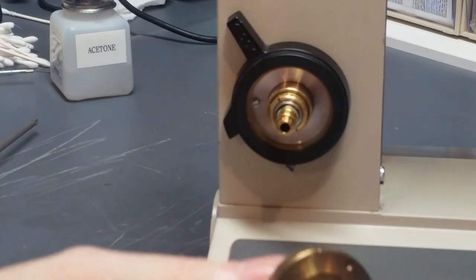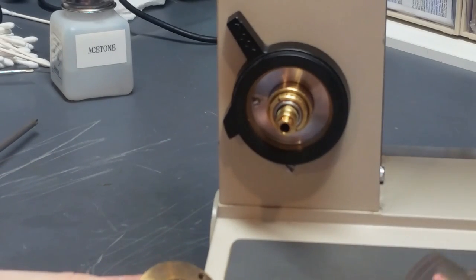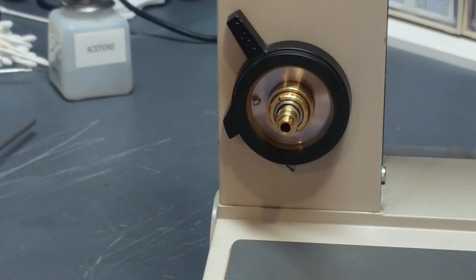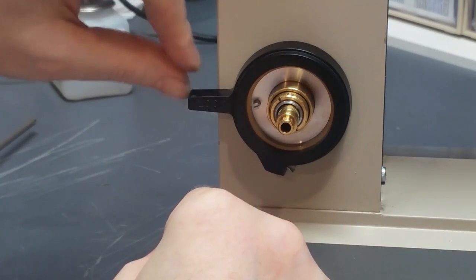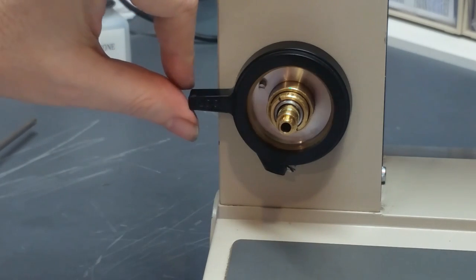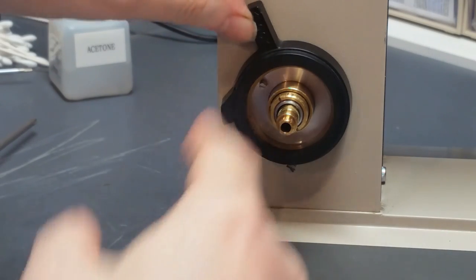Okay, so now we have to put this guy on. The thing that makes this devilishly hard for some people is this spring here, this coil spring. This spring has to be preloaded when it all goes together, and it can take a while to figure out the process, so hopefully I can give you some tips that'll help with that. Start out, loosen this up, adjust this disc in here so that the pin there is, I don't know, 9:30, 10 o'clock position, something like that. Snug it down so it won't go anywhere.